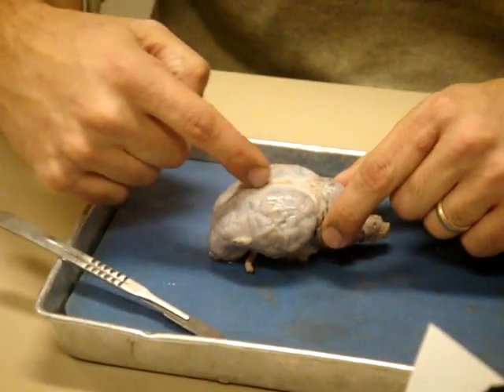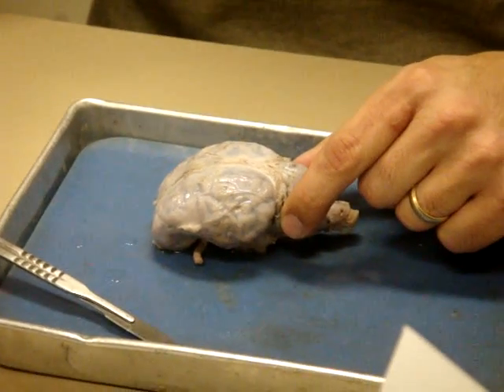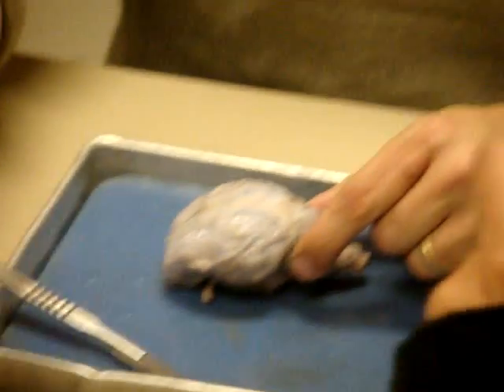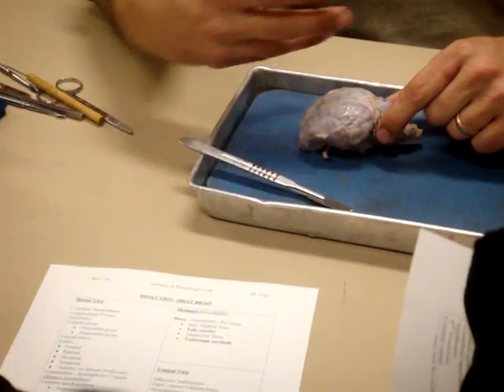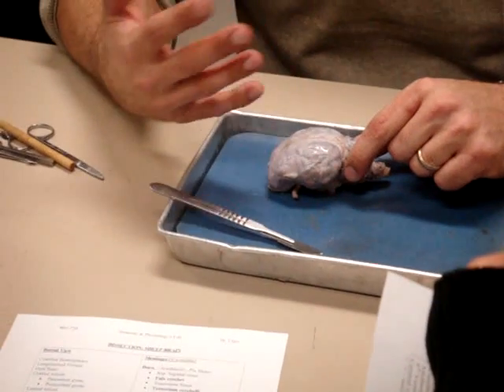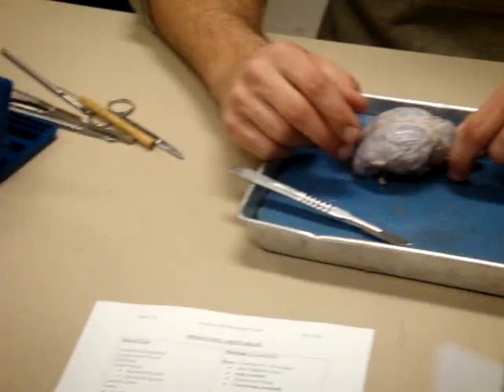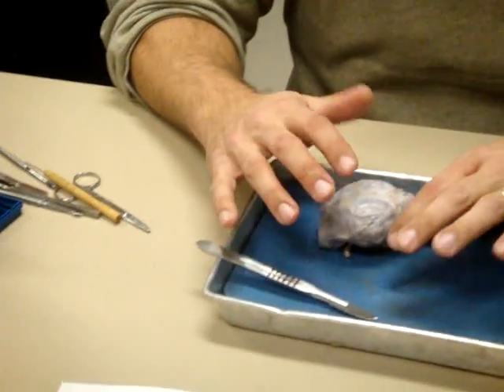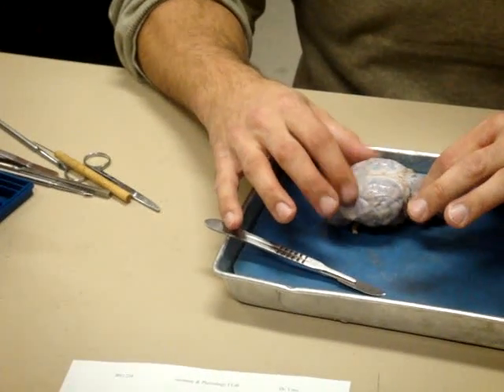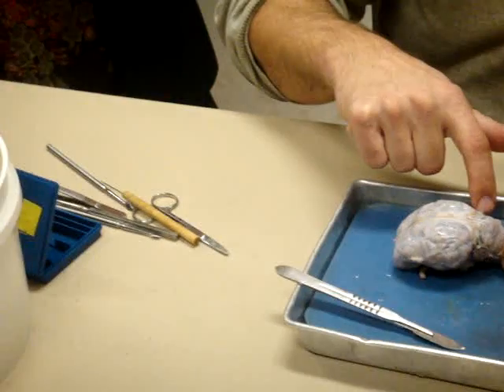This one is called the superior sagittal sinus. I made a little area here. I thought I did. Oh yeah, for meninges. So you can see, I put dura, arachnoid, and pia. You can't really see the arachnoid mater on here. It's really like adhering to the inside of the dura, and you don't really see it. You just got to kind of know it's there. And then the pia mater, you'll just see that's right on the surface of the brain itself, that shiny surface. And you can also see it thickened here between the cerebellum and the cerebral hemispheres.